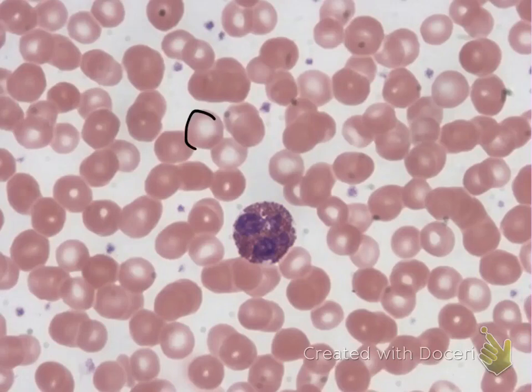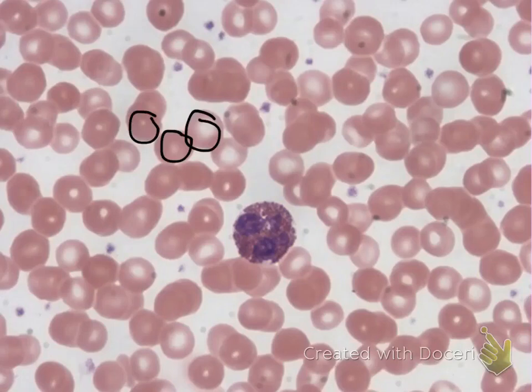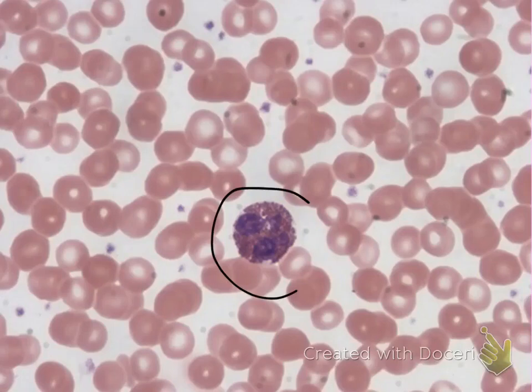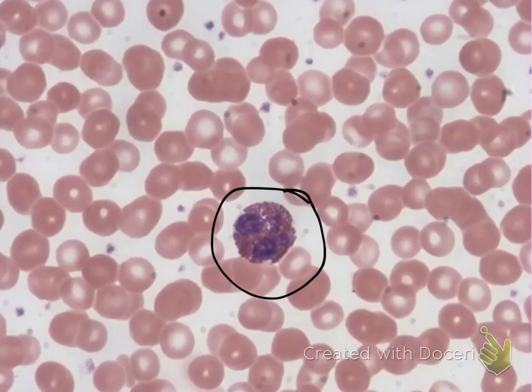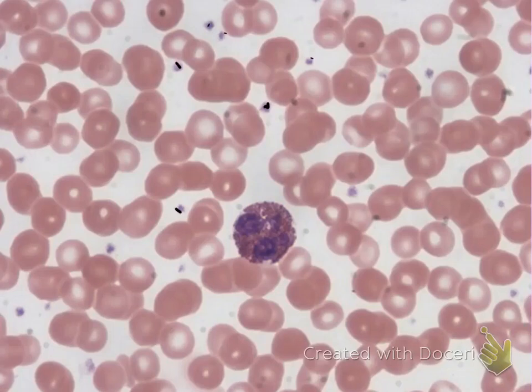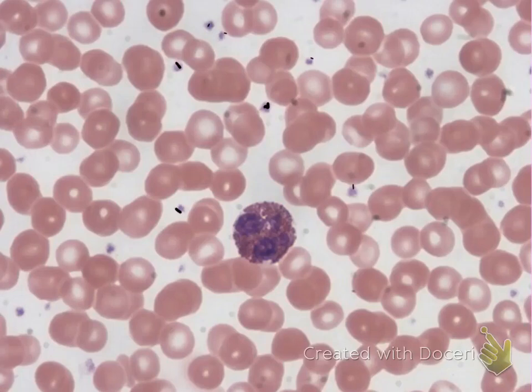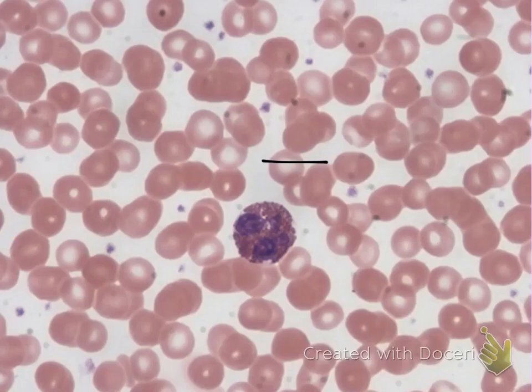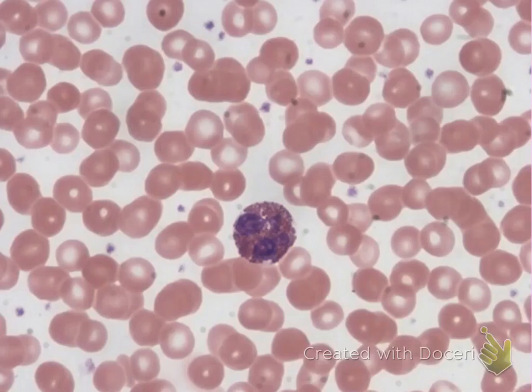Notice the red discs, which are your erythrocytes. Notice the large blue structure — that is your leukocyte, your white blood cell. These tiny little dots everywhere are your platelets. The light color background is your plasma. All those structures are found inside the blood tissue.